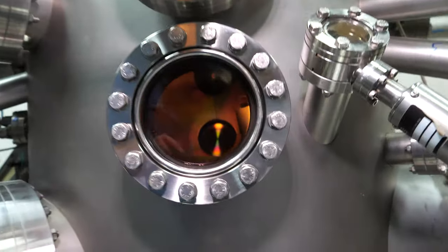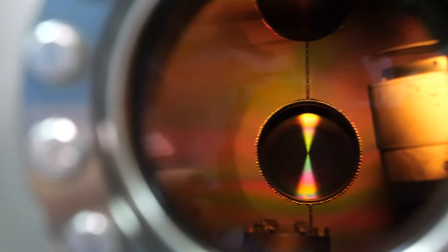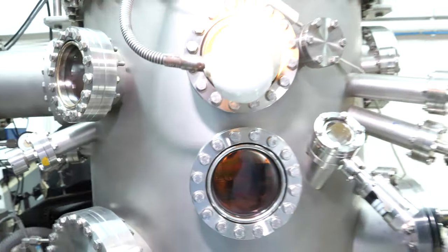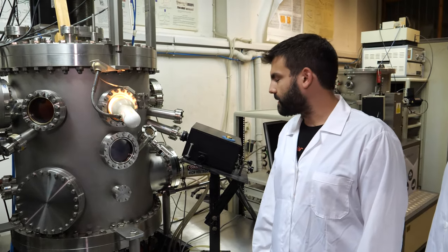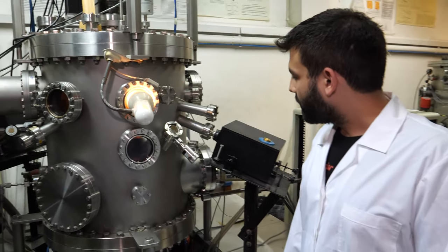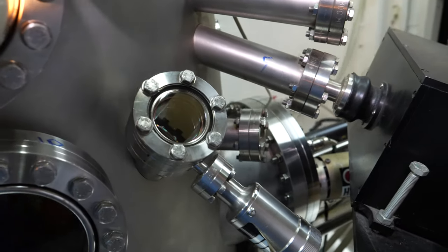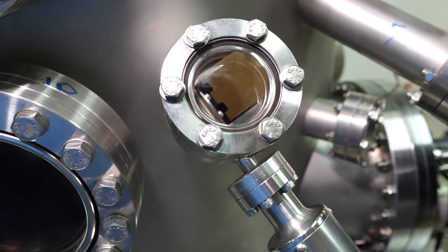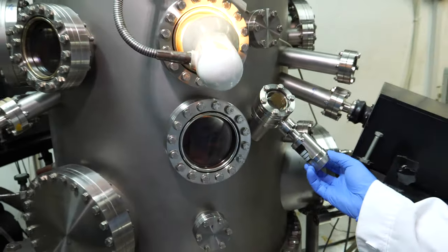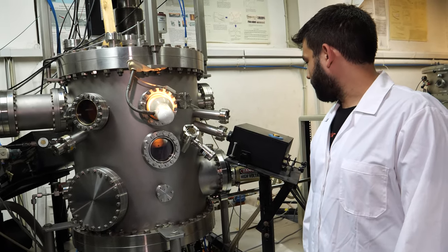If you want to see the machine inside — here you can see the gate of the pump, which makes the vacuum in there. And also here we have the sources where the e-beam evaporator is focused on these sources and the material is evaporated and deposited on the substrate inside the vacuum.